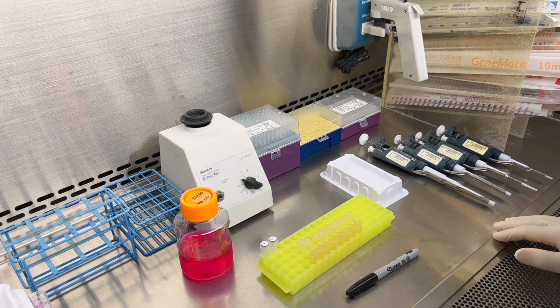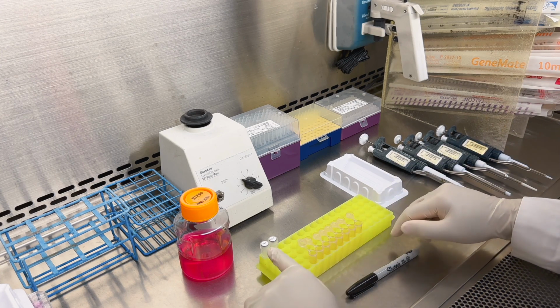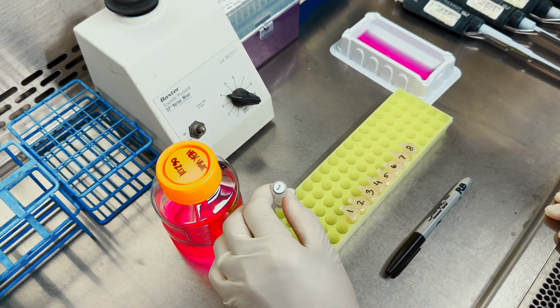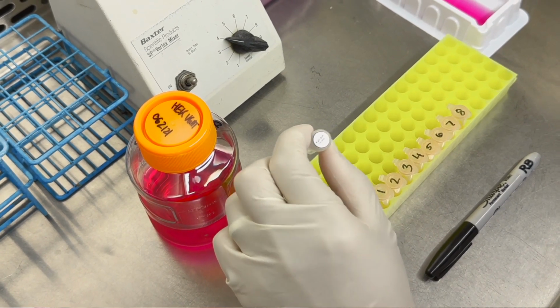In this section of the video, we will prepare the sample dilutions for the 2 negative controls. The first thing we need to do is remove the 2 negative controls that come included in the kit. The first one is saporin alone. The second is either blank streptavidin-ZAP or biotinylated IgG-ZAP.